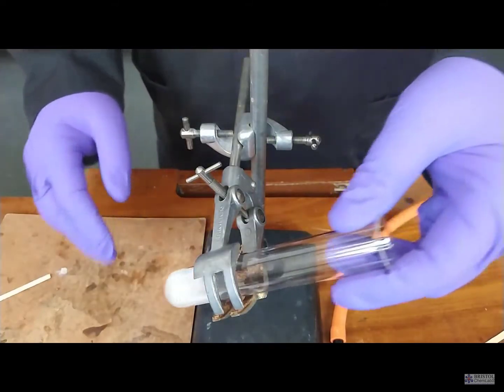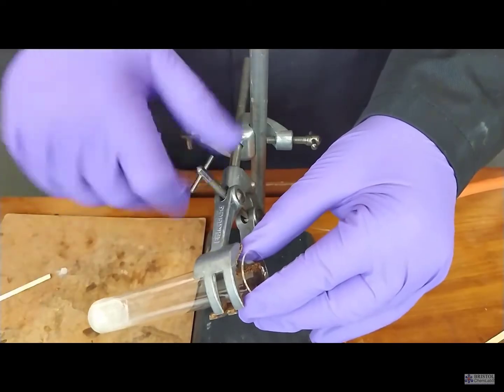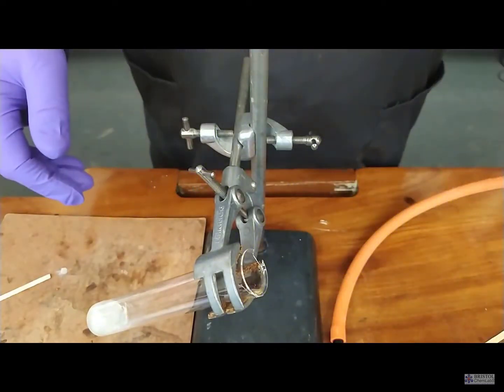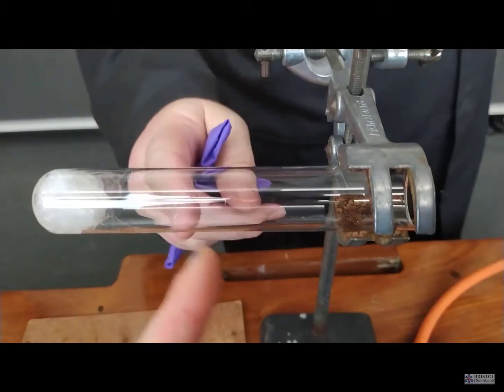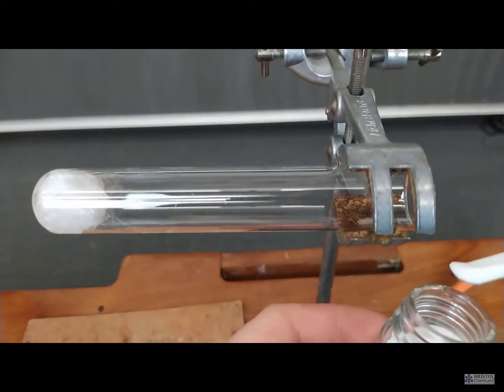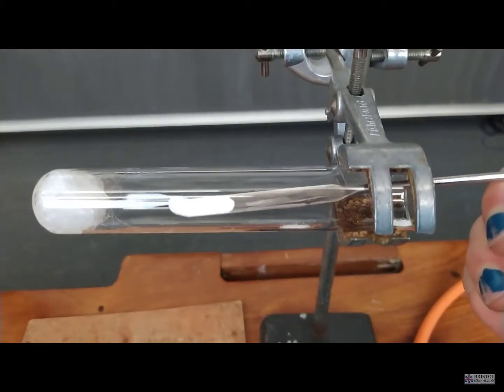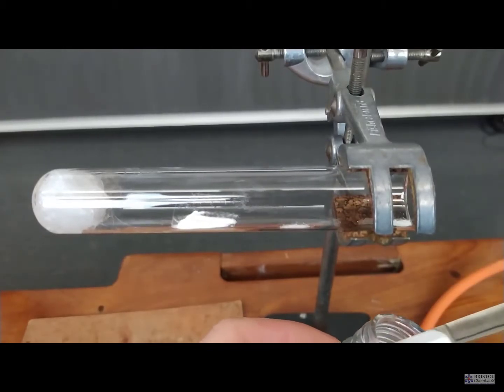When clamping up the tube, you need to clamp the tube as close to the end of the tube as possible. You will need to watch out for small cracks in the tube itself, as we didn't do here.